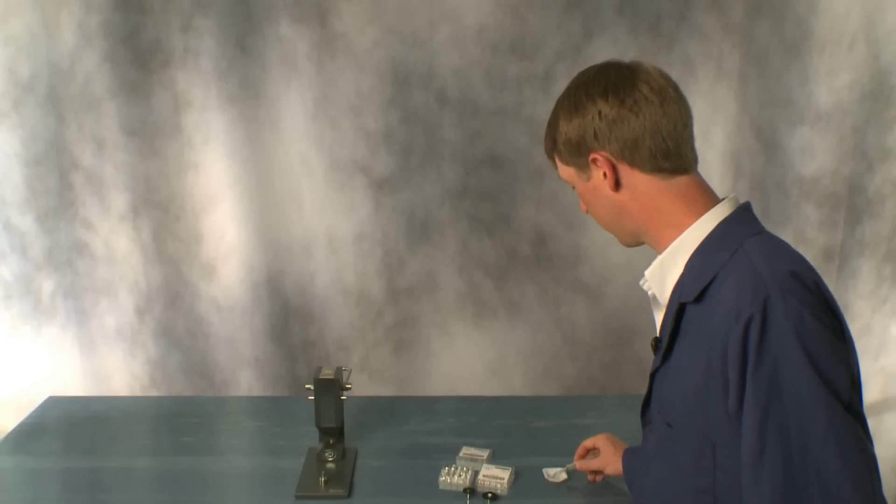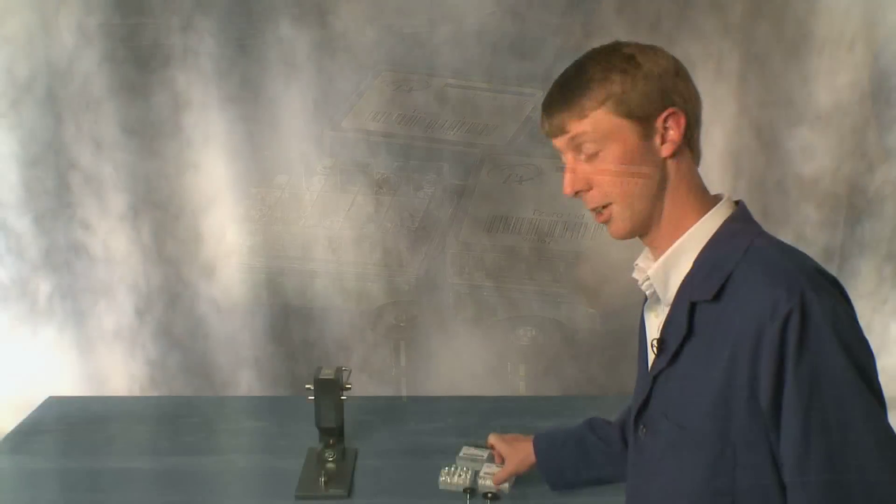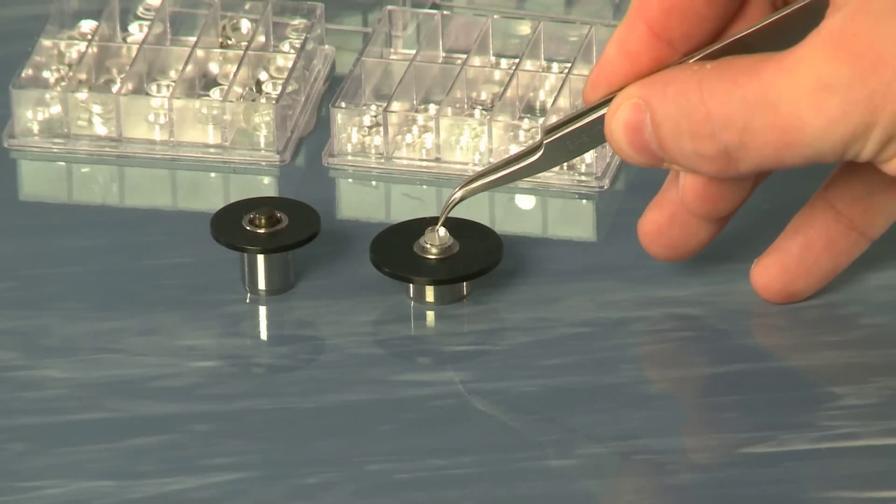Place your sample into the center of the pan and grab a lid. The lid goes in with the flat side facing down.